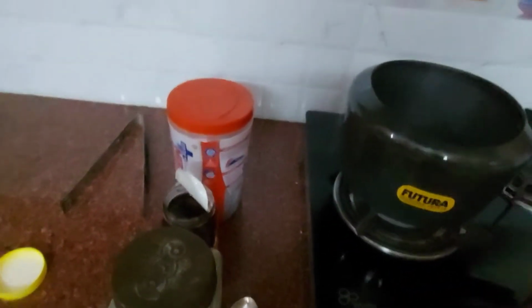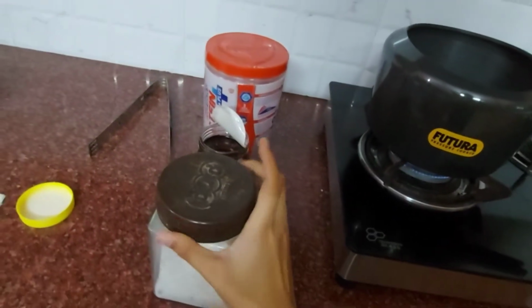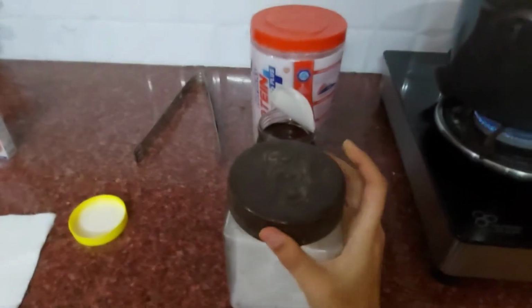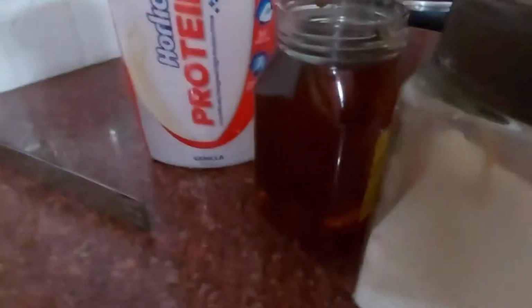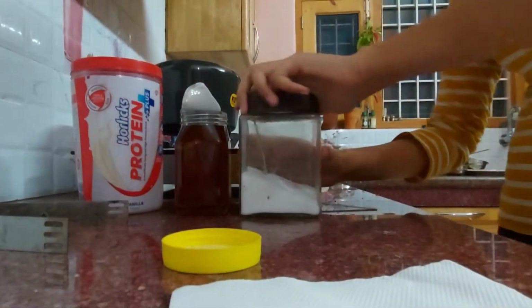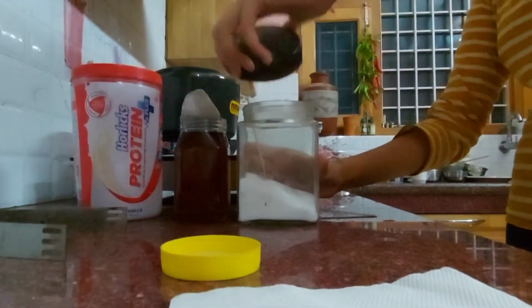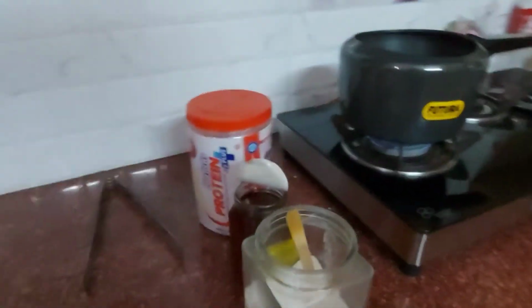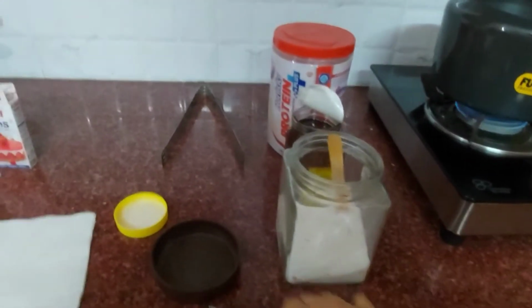For this I am going to open this. I am going to add this.